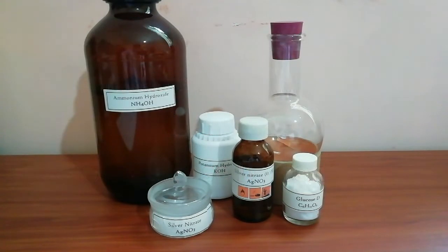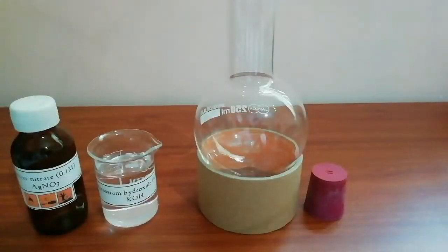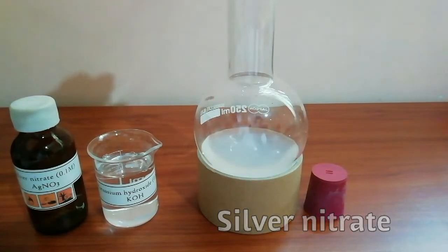For this reaction, first we need to add 50 milliliters of silver nitrate solution.